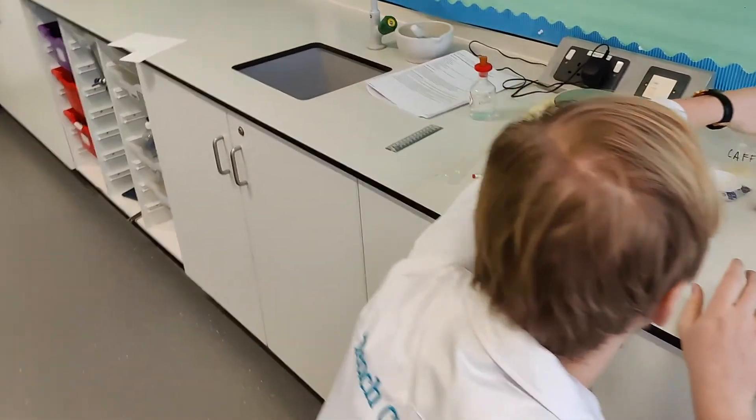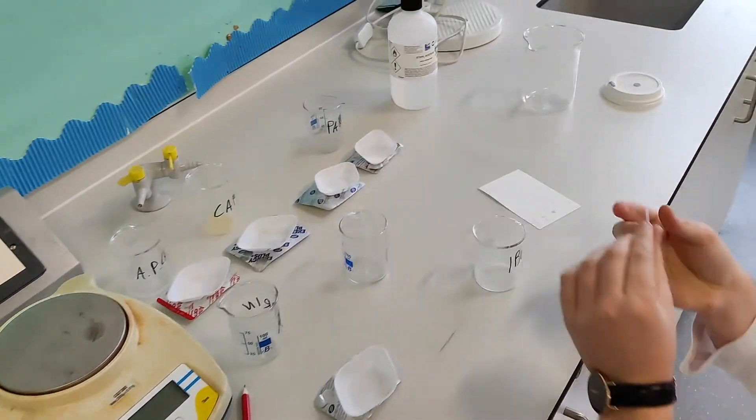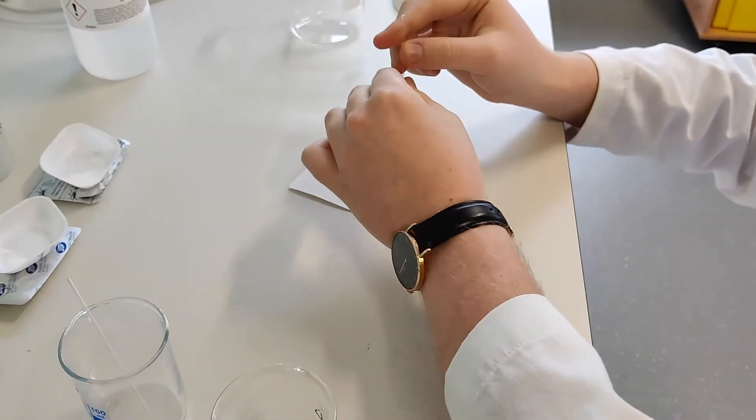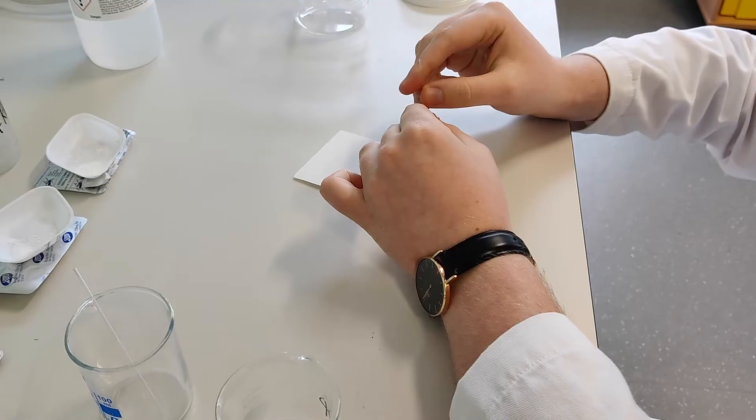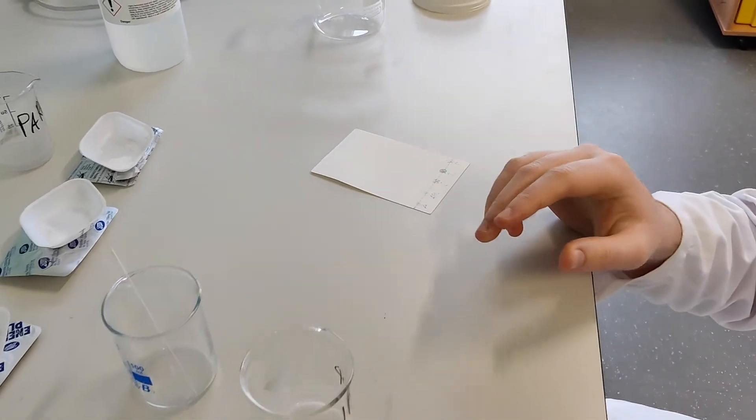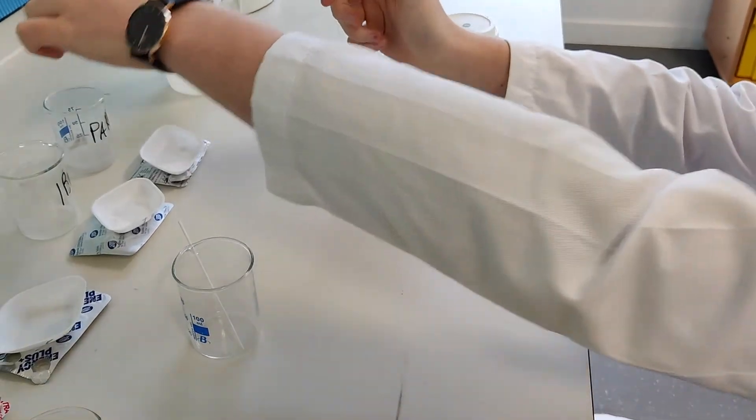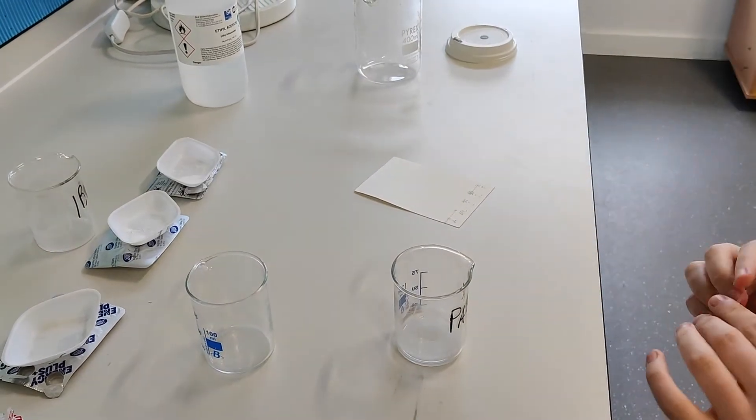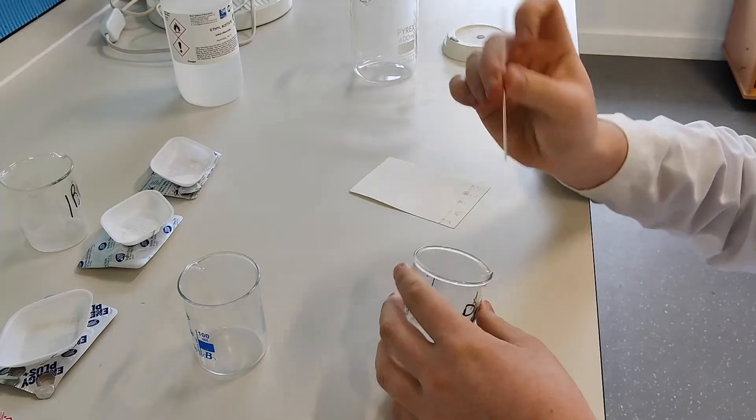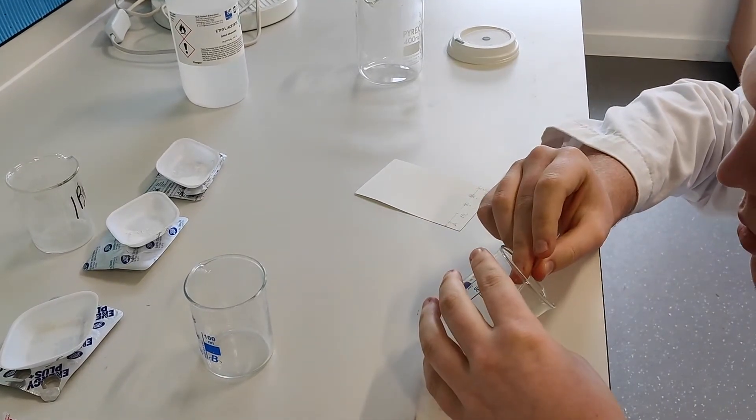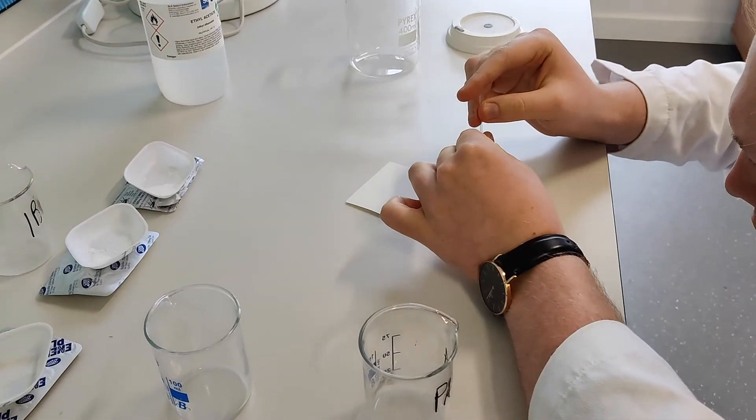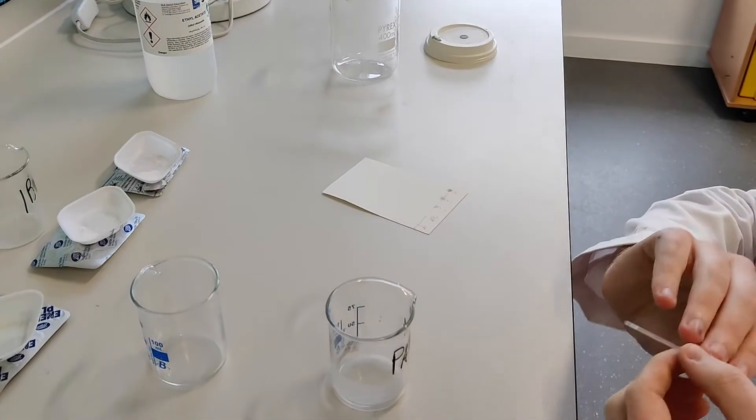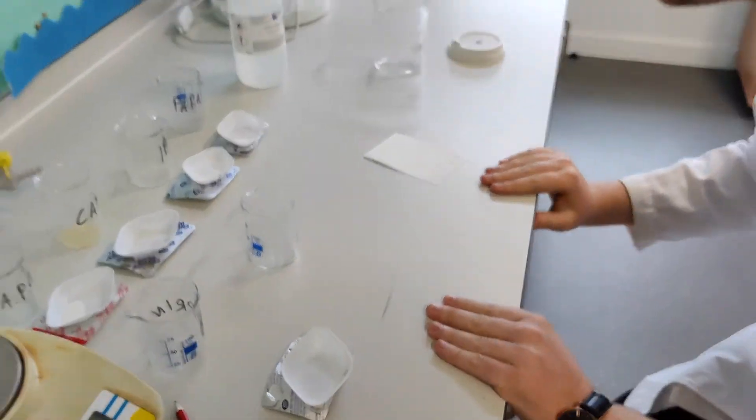I'll just go around the other side so we can get a better view on this. I'm going to have ibuprofen now. One advantage for using this capillary tube to take up the solutions is the fact that you only will get the solutions mostly coming up. So you don't get a lot of the solid. You get mostly the solution, not just the solid. So all of our spots are on the TLC plates.